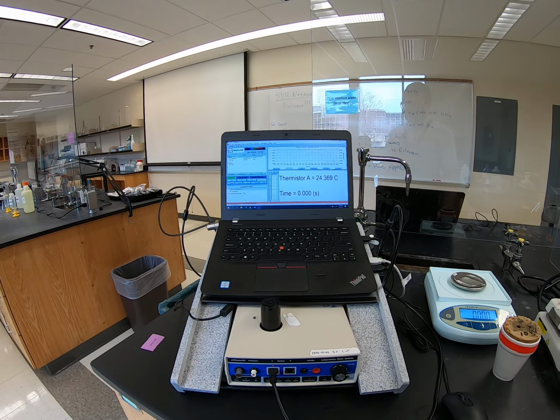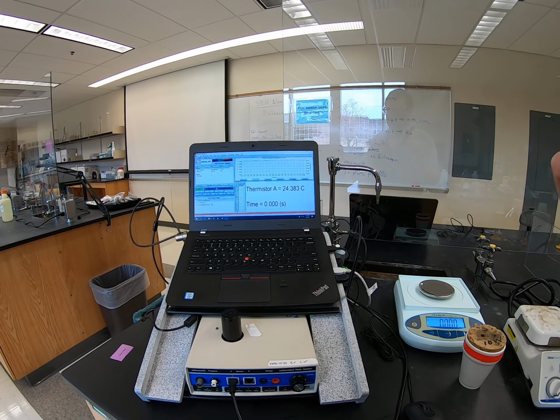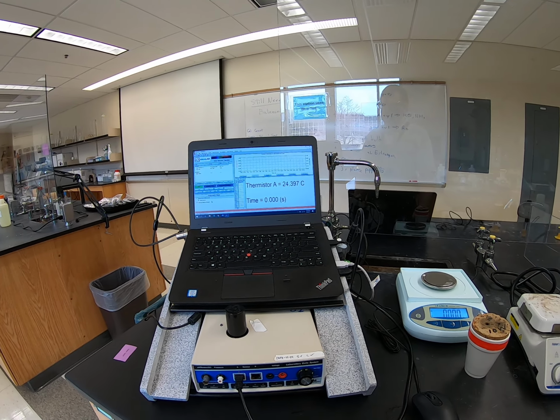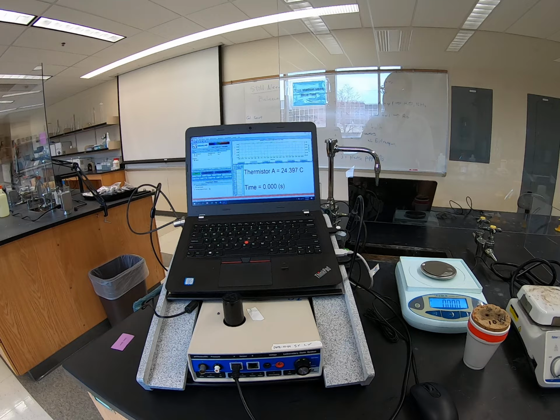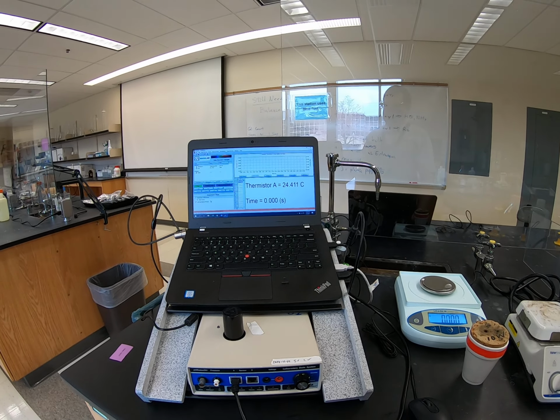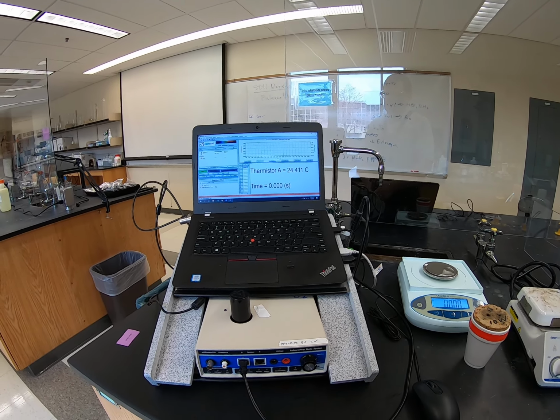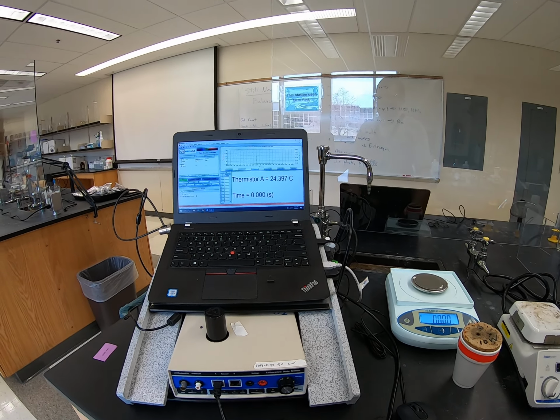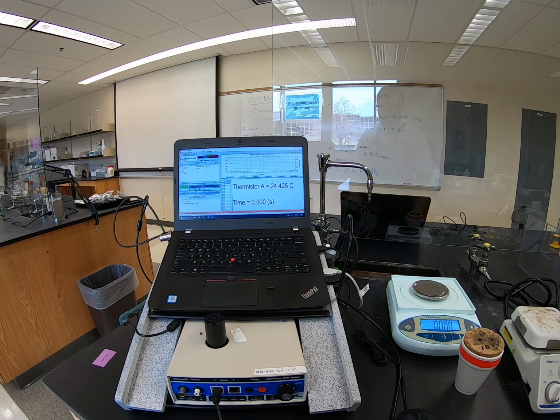All right, hello everybody. So this is now video number 3 for trial 2 for our lab number 5, the decomposition of ammonium chloride, or the enthalpy of decomposition of ammonium chloride. Okay, so this is trial 2 of the reaction between HCl and ammonia, so hydrochloric acid and ammonia. Okay, so let's get started.